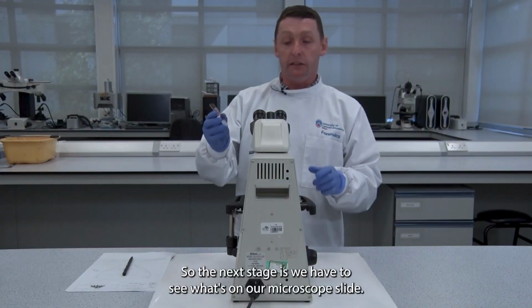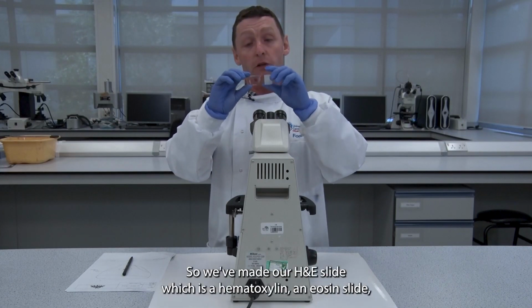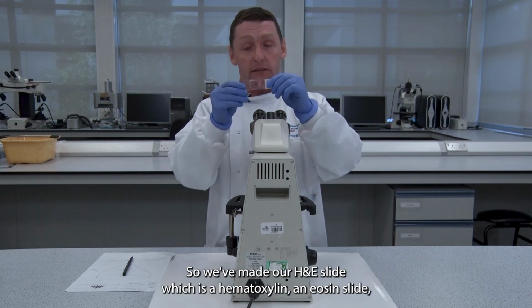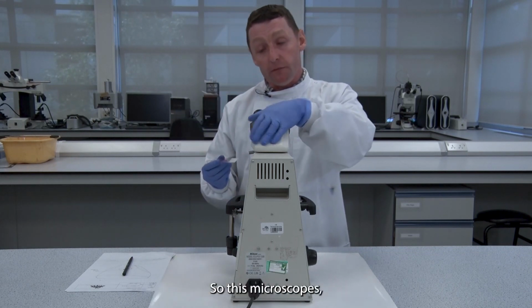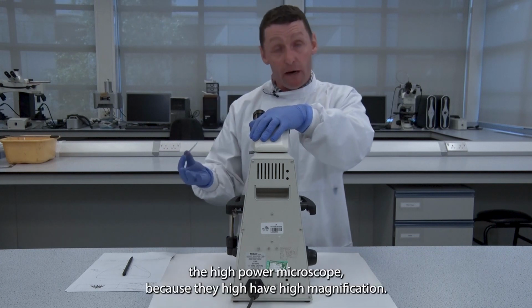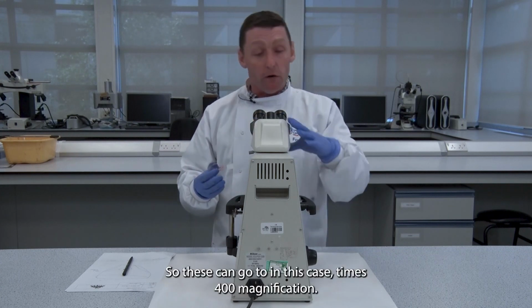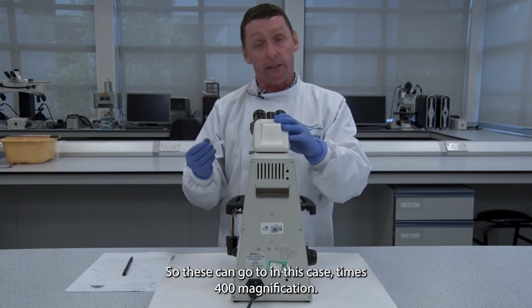So the next stage is we have to see what's on our microscope slide. So we've made our H&E slide, which is a hematoxylin and eosin slide, and we use a high power microscope. This is the high power microscope because it has high magnification. These can go up to, in this case, times 400 magnification.